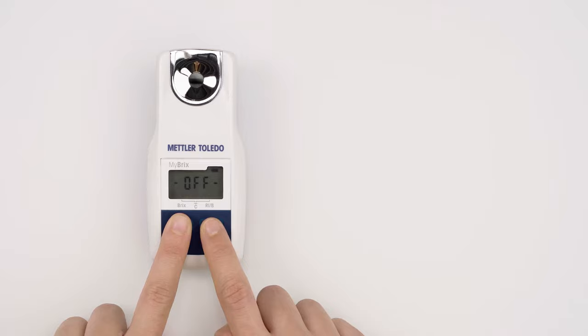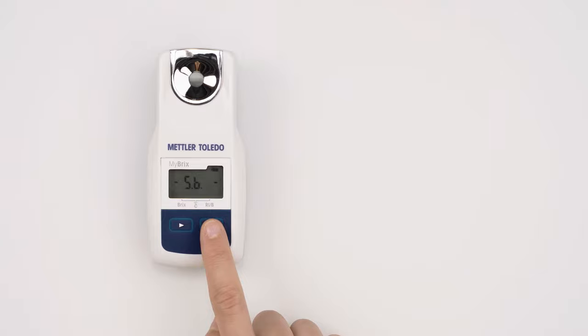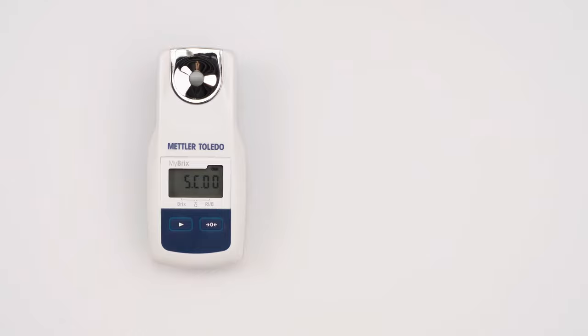Navigate the menu with the zero key. If you want to change the scale on position C, navigate the menu until you see SC. To enter scale C, press the read key. Toggle through scale C with the zero key.